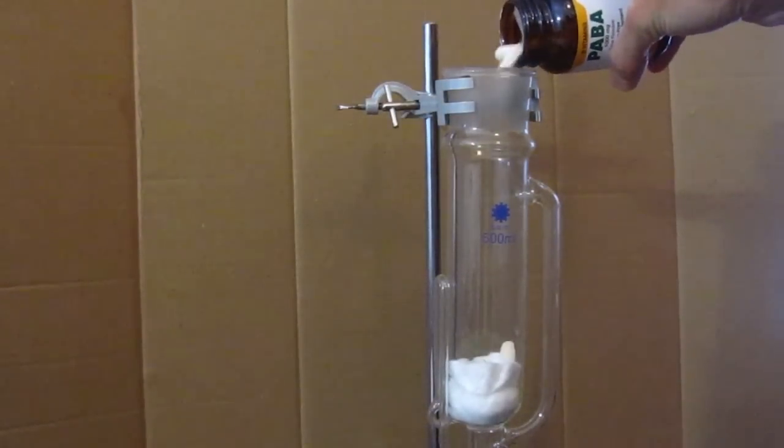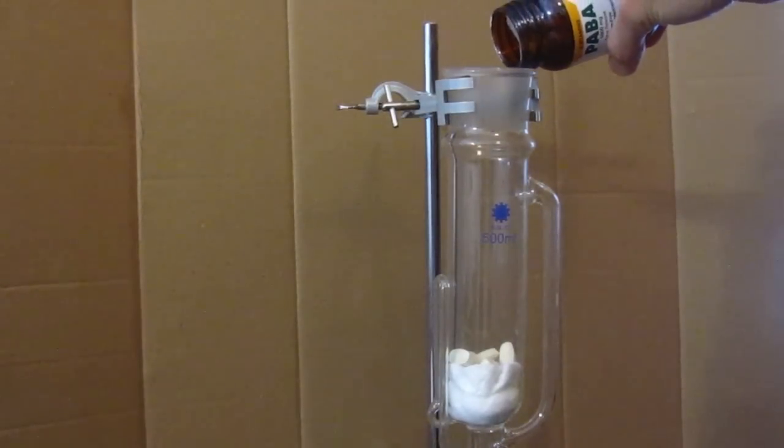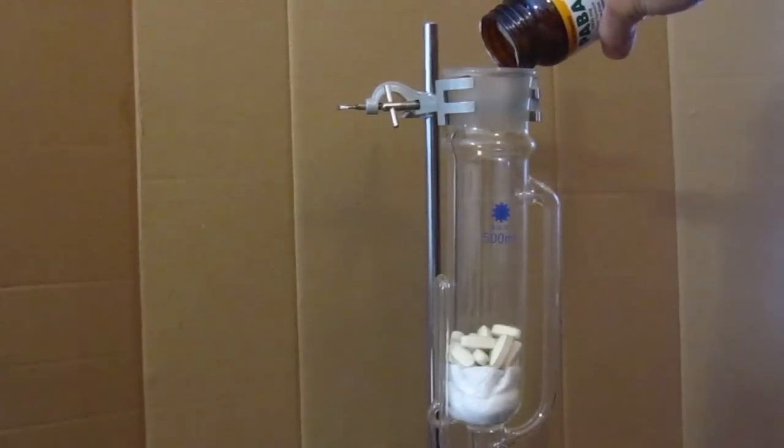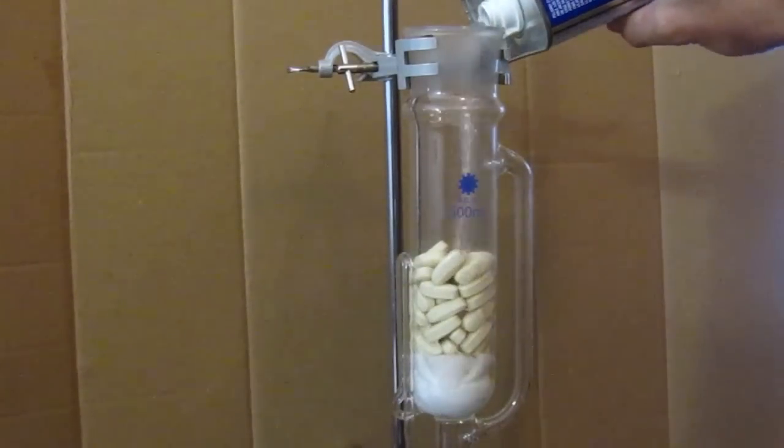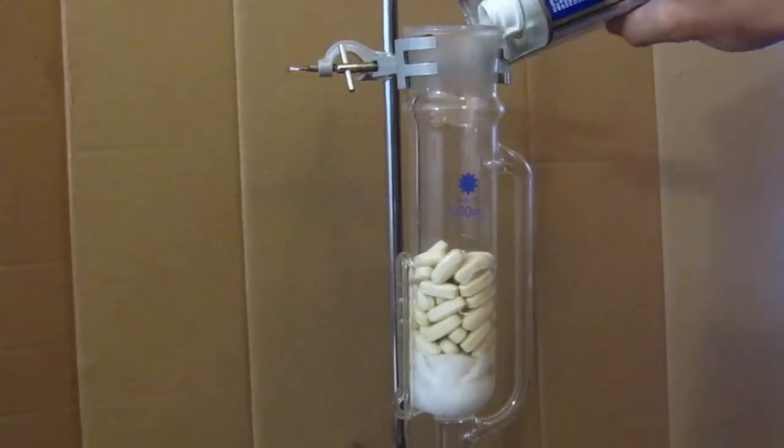So I decided to use my soxhlet extractor because number one, I love it, and number two, extracting anything else is now a gigantic pain in the ass. This is easy. Load it and forget about it.